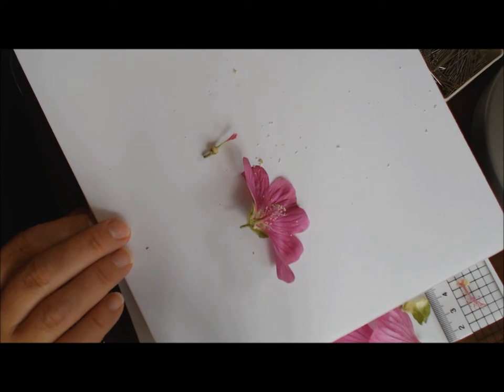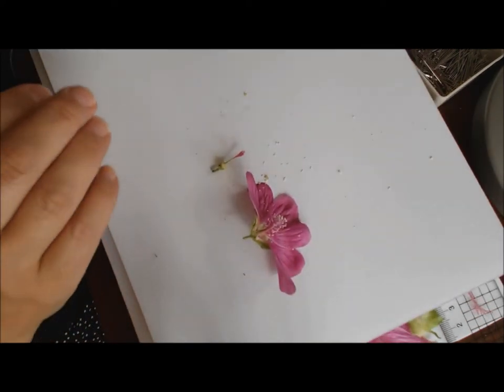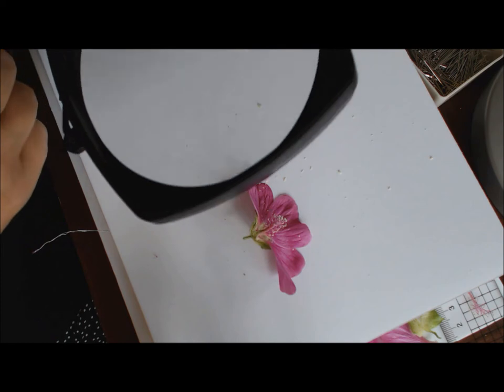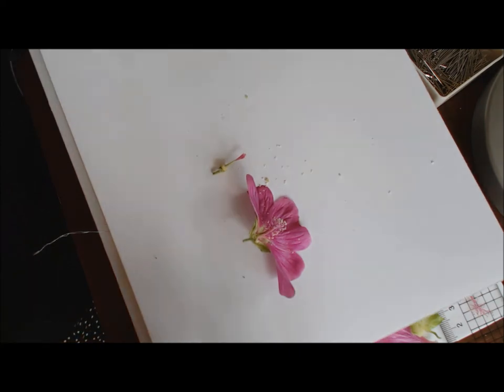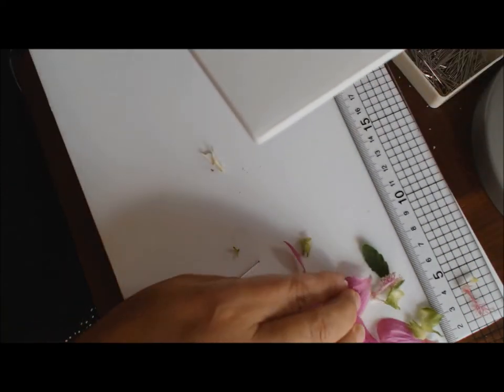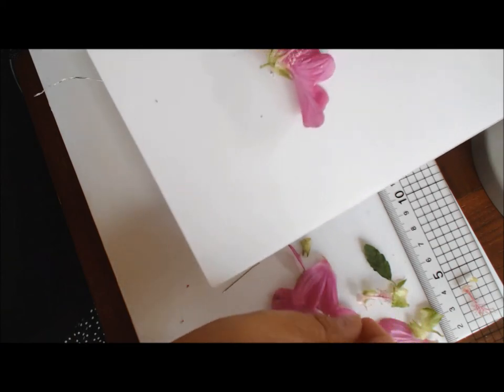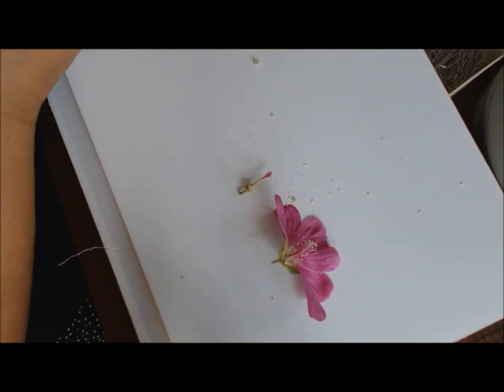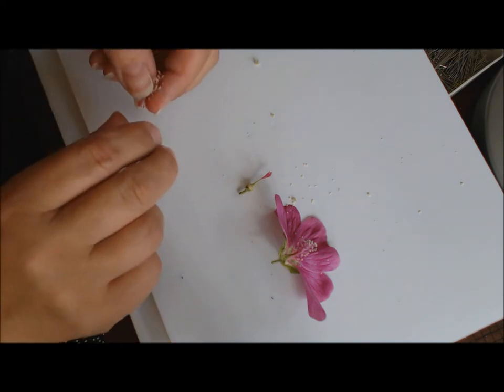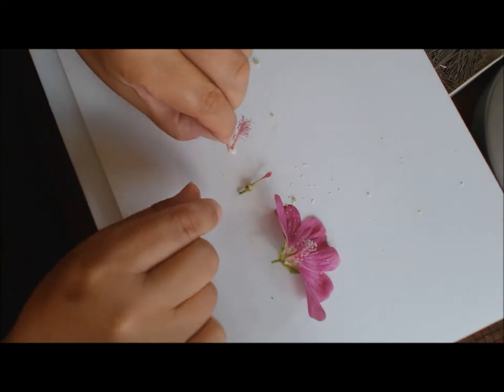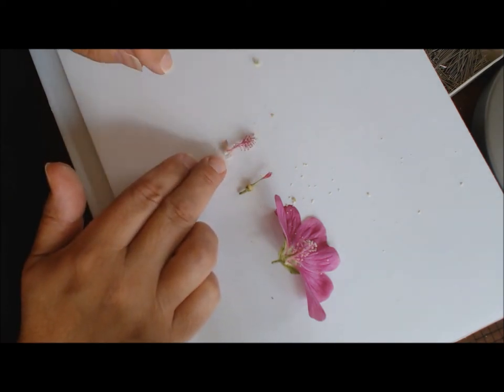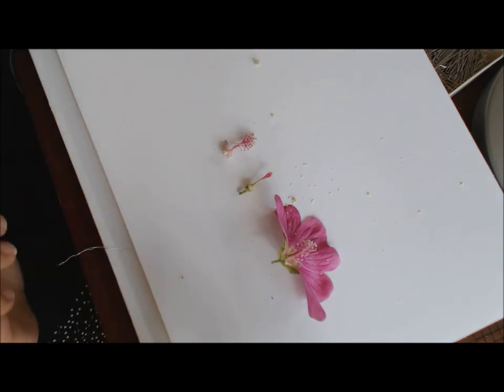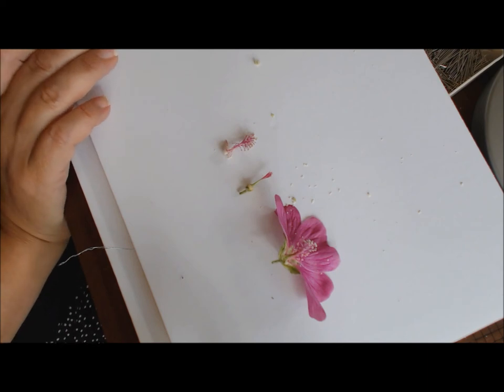That will just hold it in position for my drawing. I normally use a magnifying glass as well—this makes life a bit easier so that you can see the parts a bit more clearly. You can also draw the exterior casing or just take the whole male or female reproductive part. I could use this one as well, trim away the base of it, and that's what encases the stigma with the anthers and filaments within that column. That's worth it really, just for a basic dissection with as much as you need.